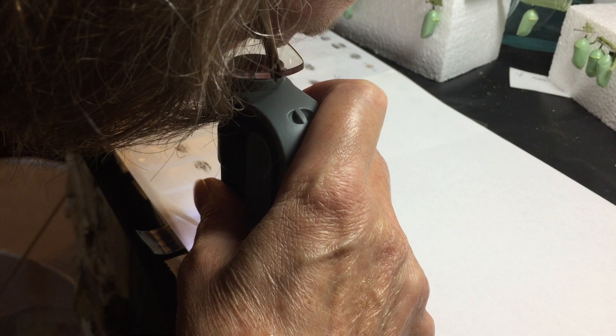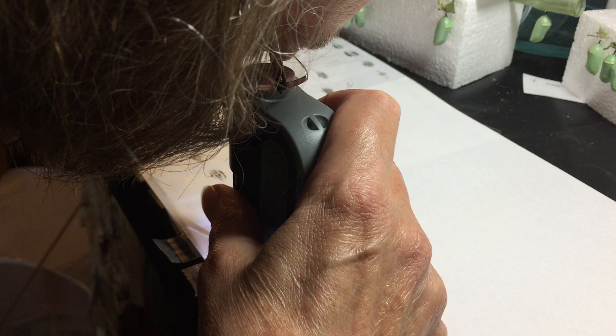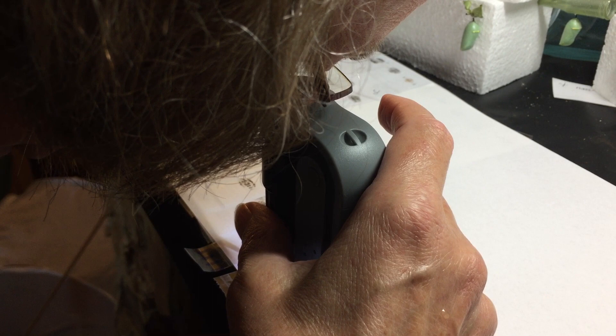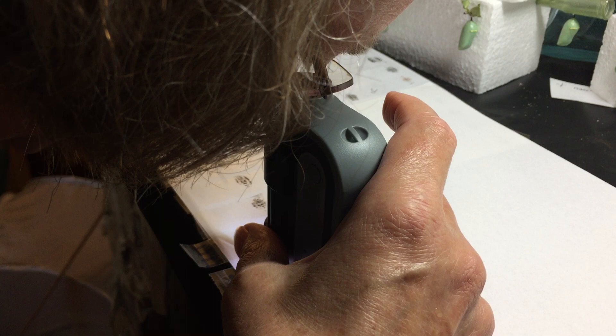So far so good. We have released one clean butterfly today. Now I move all the way around on the sample so that I'm seeing all the scales — sometimes your first view may look clean but as you move around you find pockets of OE. Hallelujah, we have a clean one!